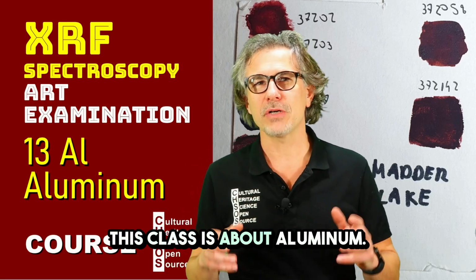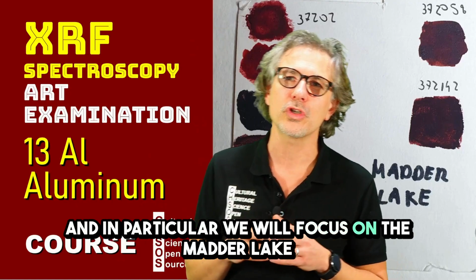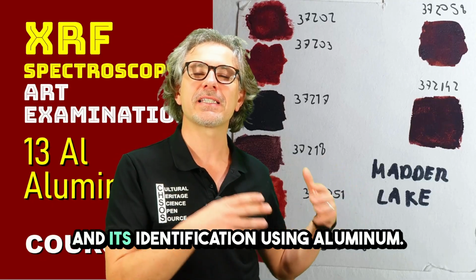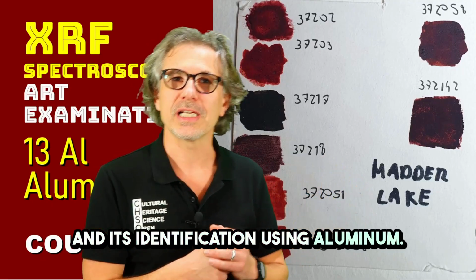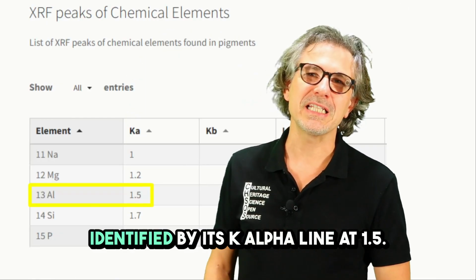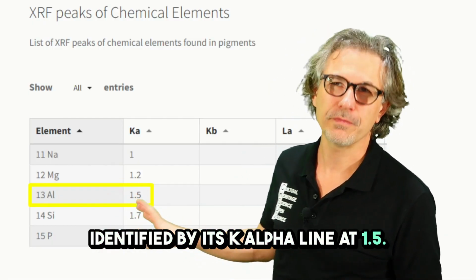This class is about aluminum, and in particular we will focus on the Madder Lake and its identification using aluminum. Aluminum, atomic number 13, can be identified by its K-alpha line at 1.5 keV.